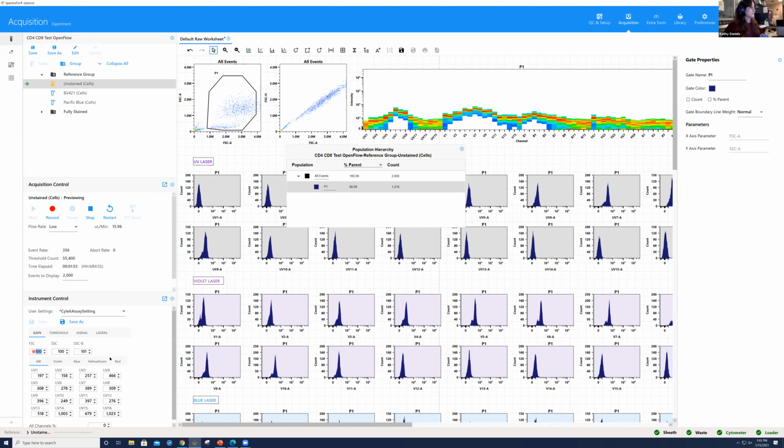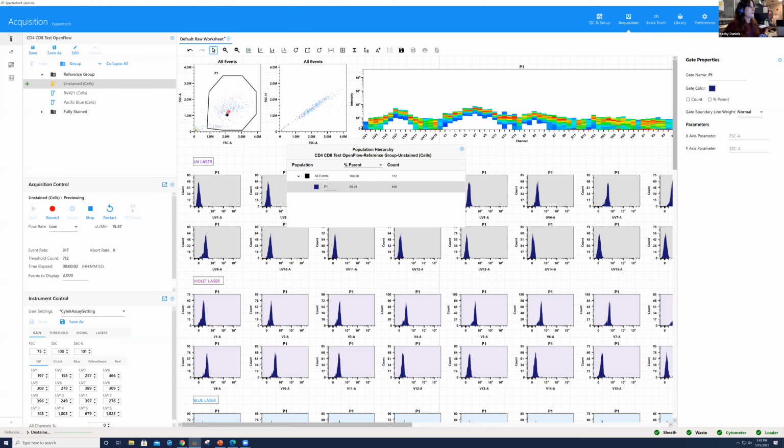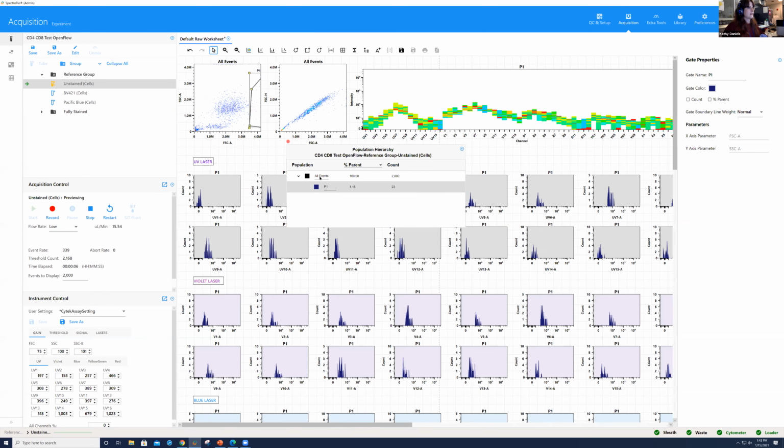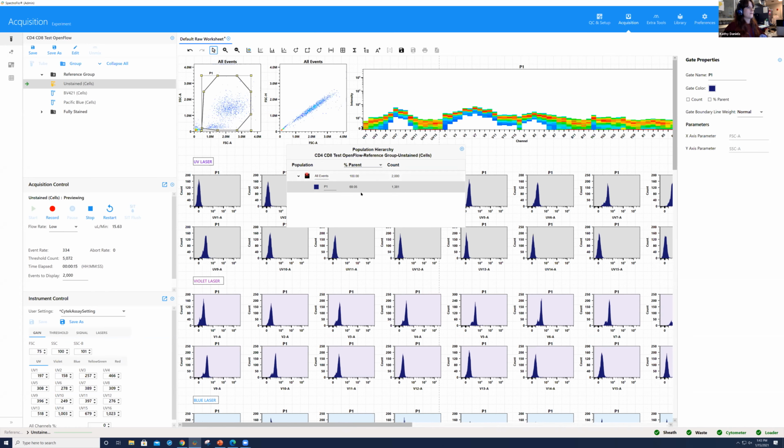So I'm going to reduce this forward scatter and bring it down to maybe about 75. And when I restart here in the acquisition control, what we see is if I bring this P1 gate to the axis, I have less than 1% that's off scale. But what I do still see is that I only have 70% in this P1 gate. You do have quite a bit in the way of background and events that we want to threshold out.